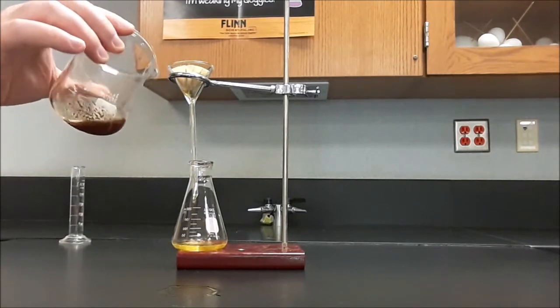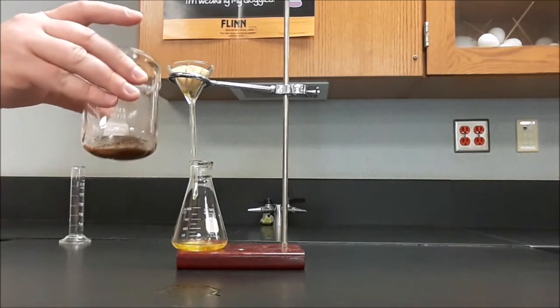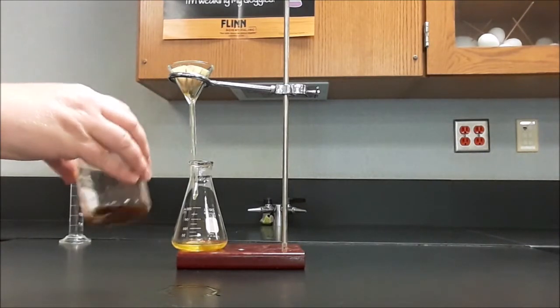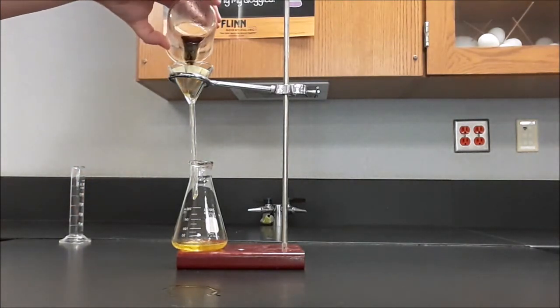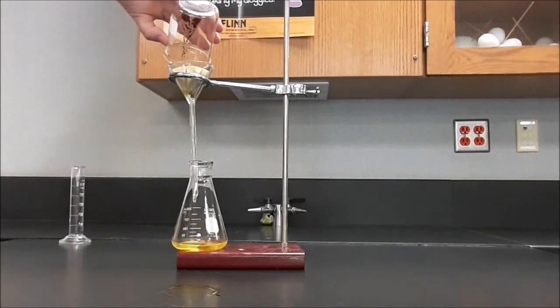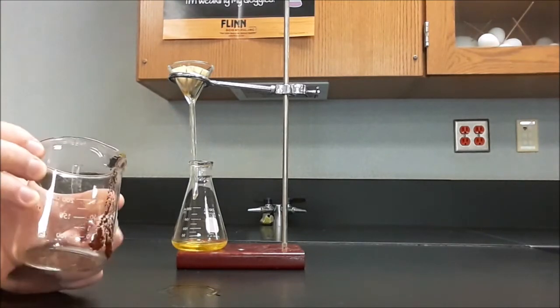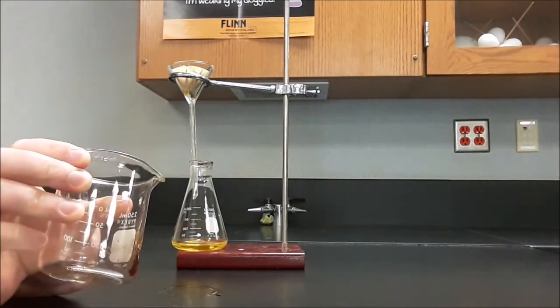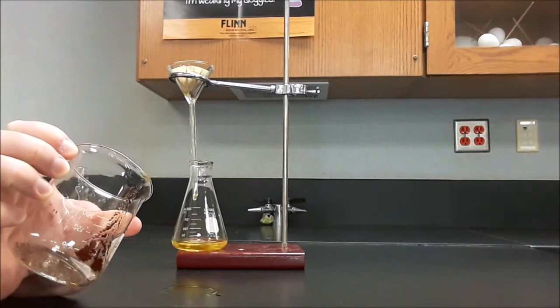I've still got some precipitate in the beaker, and it's starting to get to the point where it's getting stuck to the sides of the glass. So this is where swirling is going to become super important. Now I'm filtering pretty quickly, and I'm very happy with the speed at which this is going. The little drop that's left behind, I can touch that to the filter paper and that will suck it off of the edge of the beaker. You can see here, there's still some precipitate left in the beaker. We need to wash that out of the beaker and into the filter paper.